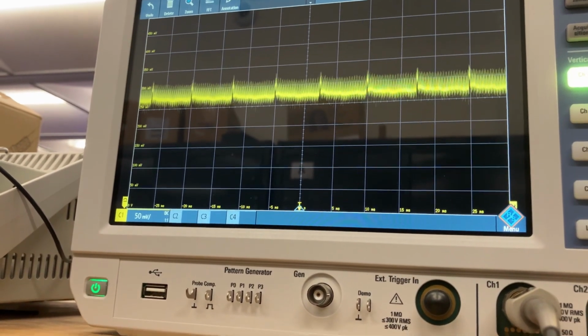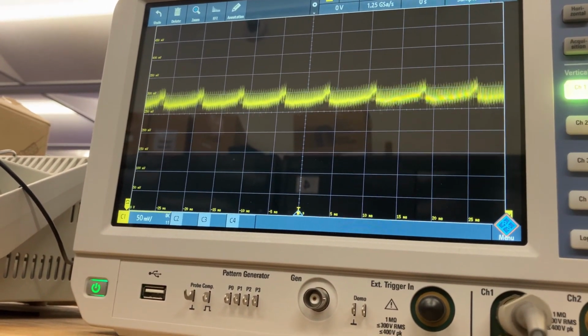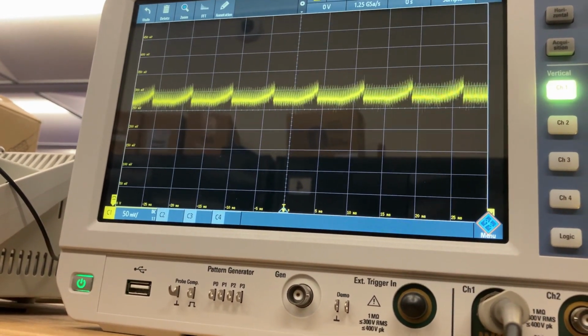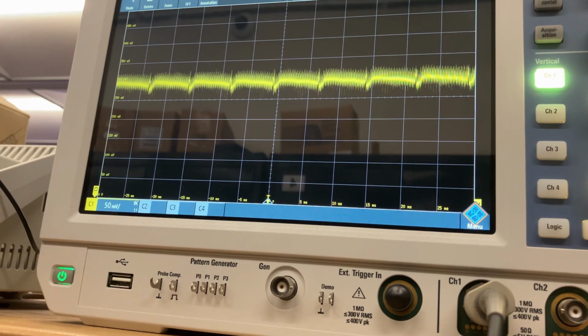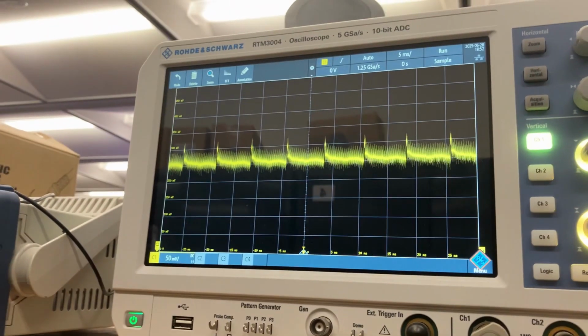The peaks every 7.5 milliseconds is the start and end of each frame. And the fluctuation there you can see is me moving my hand across the CCD from start to end, which you can see in its respective location in each frame.